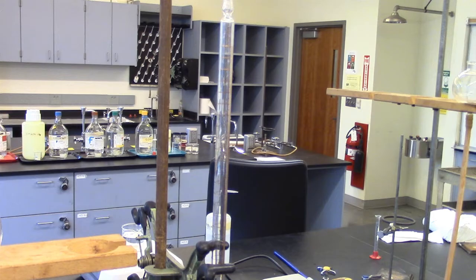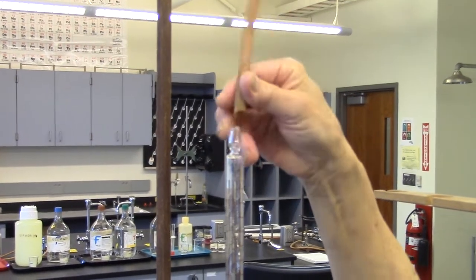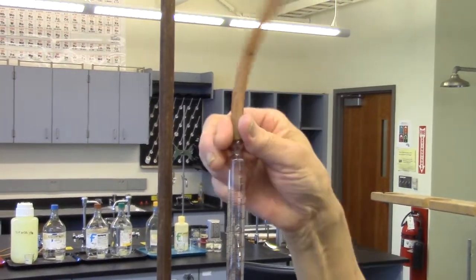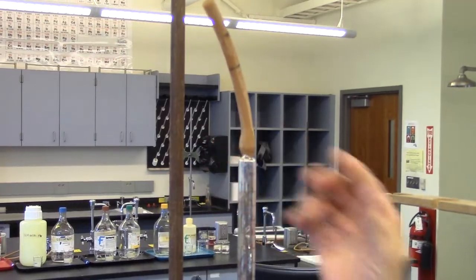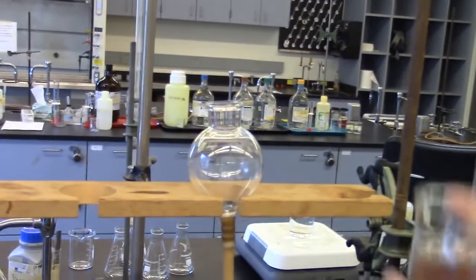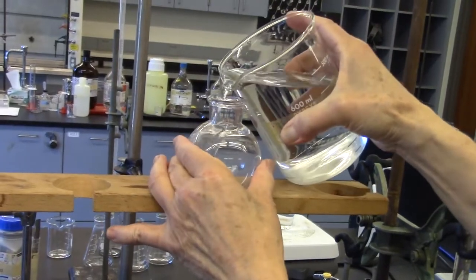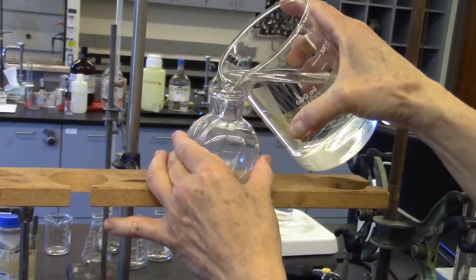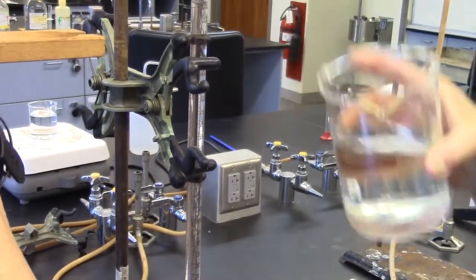When placing the water manometer, be sure that the zero reading is at the top. Attach the small piece of tubing to the top of the burette. Add water to manometer through the leveling bulb. Get rid of the air bubbles in the leveling bulb tubing.